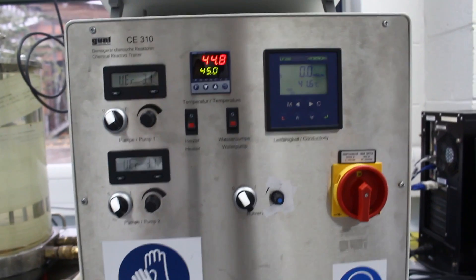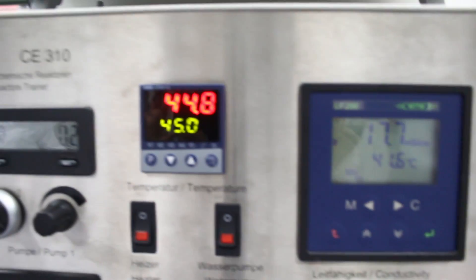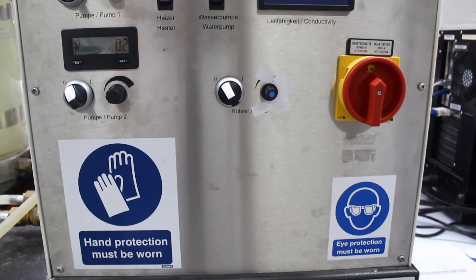The next thing we're going to look at is the equipment. We didn't use a lot of equipment in this experiment. The main piece was the CE310 trainer — here we have it in the lab, not at industrial size, and here it is turned on. On the right, at the top we measure the conductivity, and at the bottom we measure the temperature. The two knobs represent the flow rate for both chemical pumps, connected to either the CSTR reactor or the plug flow reactor. The CE310 trainer enables us to calculate the conductivity and temperature of the reaction, so we can observe the rate of reaction by the time it takes to occur.